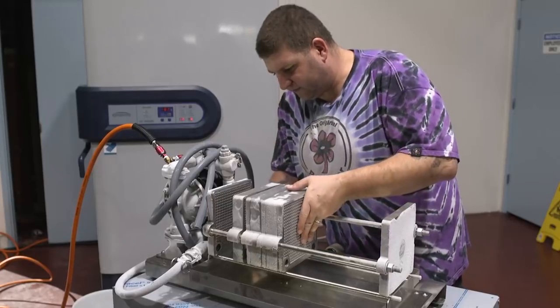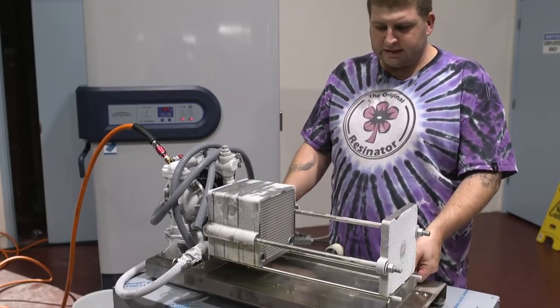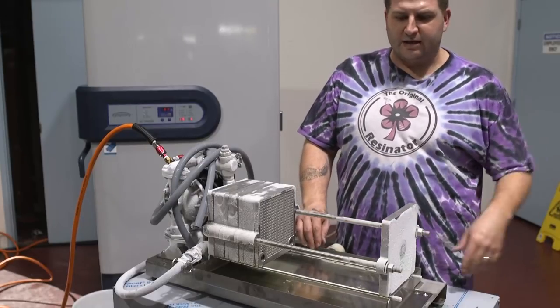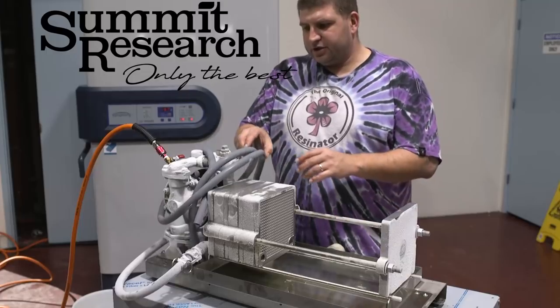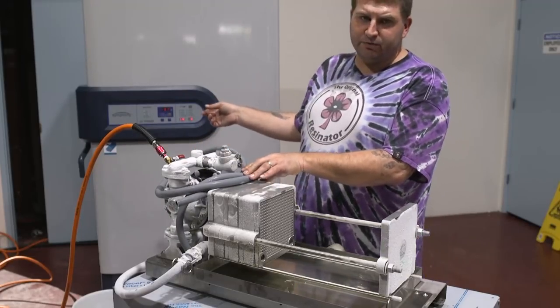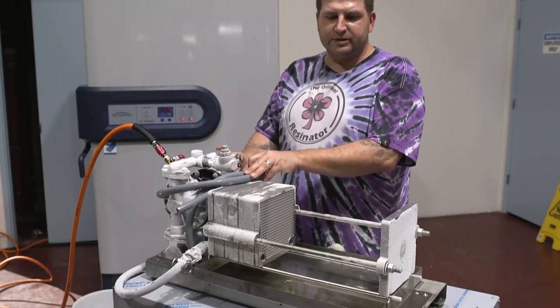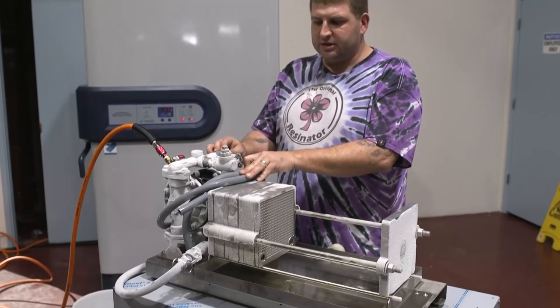And that's it. As you can see from the demonstration, there's very little alcohol in here. Once the system is drained, the loss is almost none. This is a demonstration tray — it does not have a drain, but if it did, all this would just go to a gallon jug. There's no misrepresentation of the temperatures — this system was at negative 70 when we started pulling fluid out, and it warmed up a little bit, but it still operated flawlessly. If you have any questions, please call us. We're more than happy to help you get going with these types of filtration speeds. Thank you.